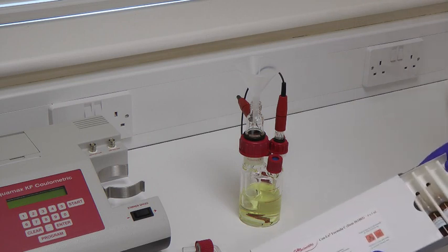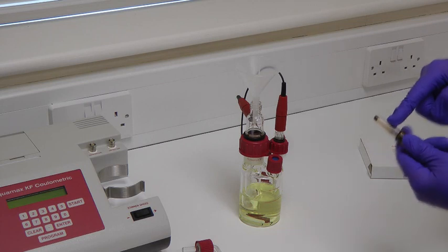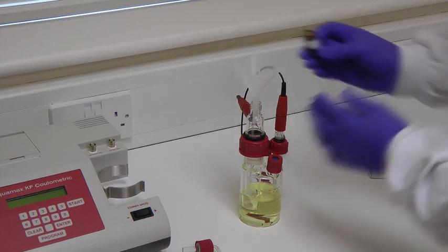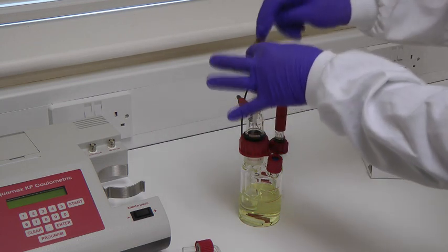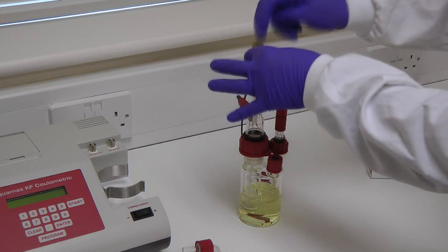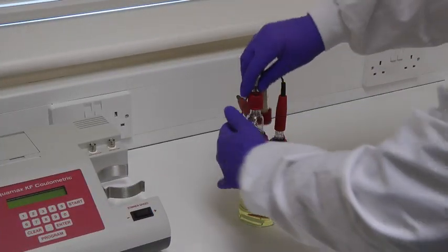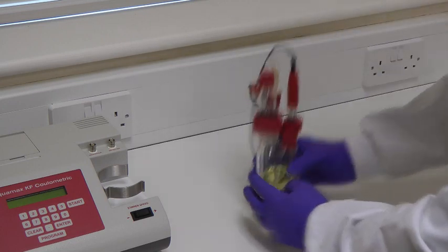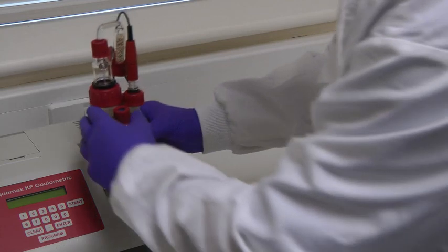Take the cathode reagent, snap the vial which has a safety snapper already fitted, and pour the reagent into the inner chamber of the generator electrode. Reconnect the drying tube, relocate the glassware onto the Aquamax KF moisture meter, and connect the electrode leads onto the appropriate sockets.